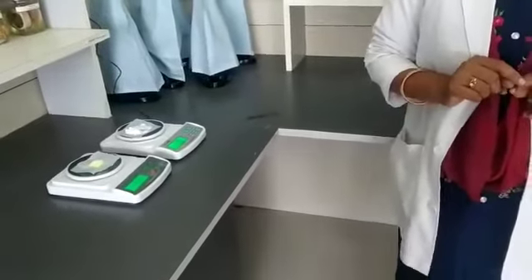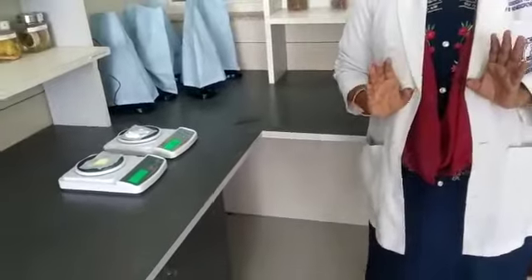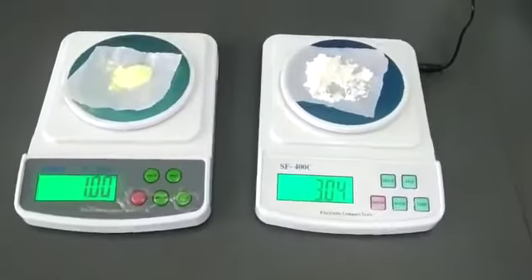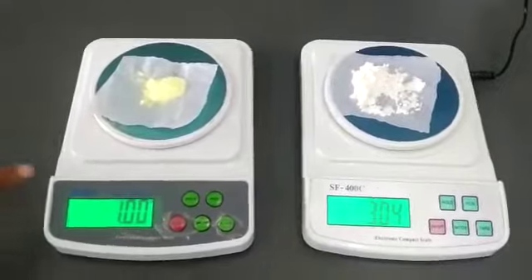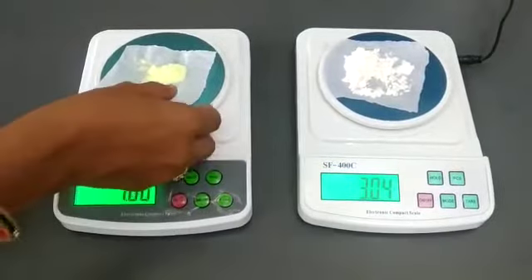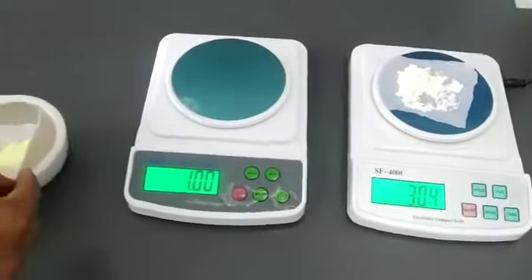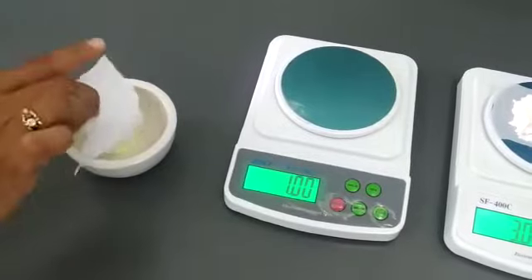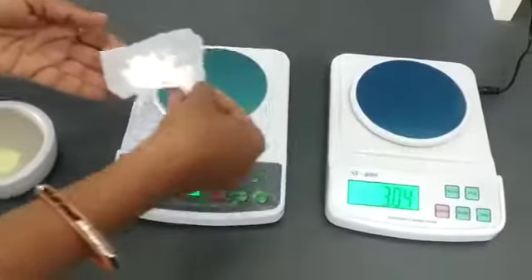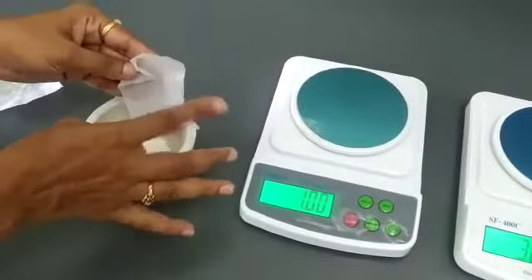We are going to take 1 gram of crude sulphur and 3 grams of sugar of milk and transfer them into the mortar. So we have taken 1 gram of sulphur and 3 grams of sugar of milk in the mortar.